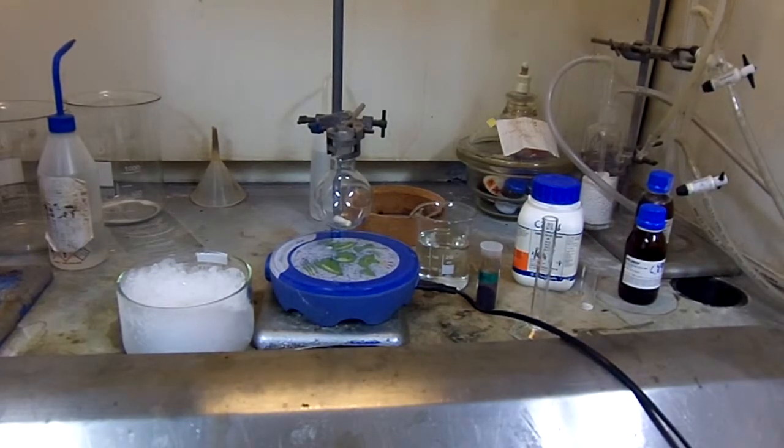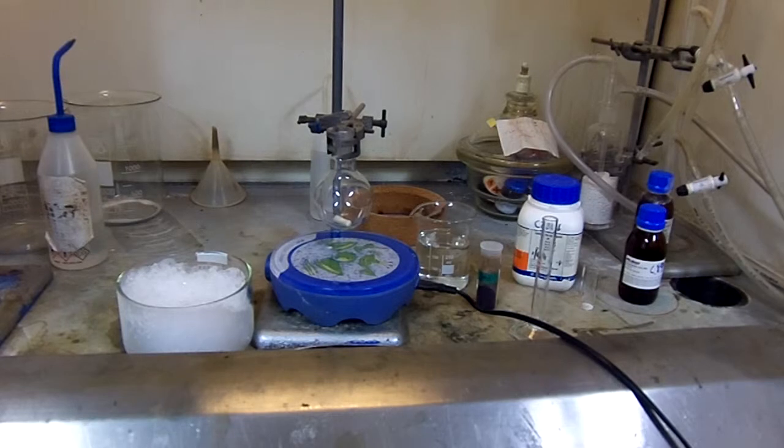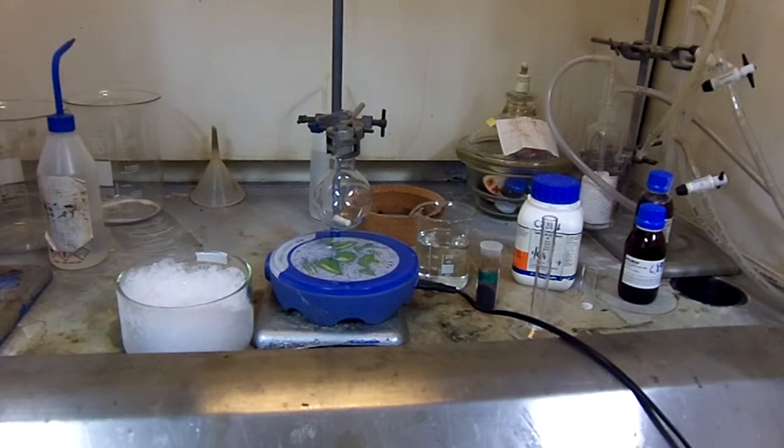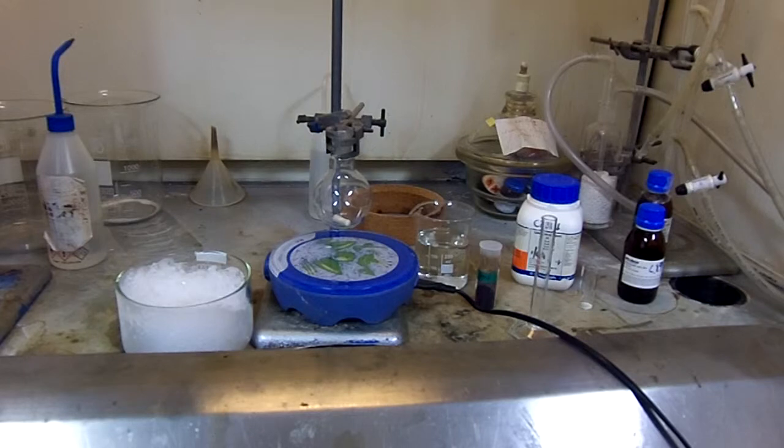For this you will need an ice bath, a stirrer hot plate, a 100ml round bottom flask, a beaker of water, TPP, sodium nitrite, and trifluoroacetic acid.